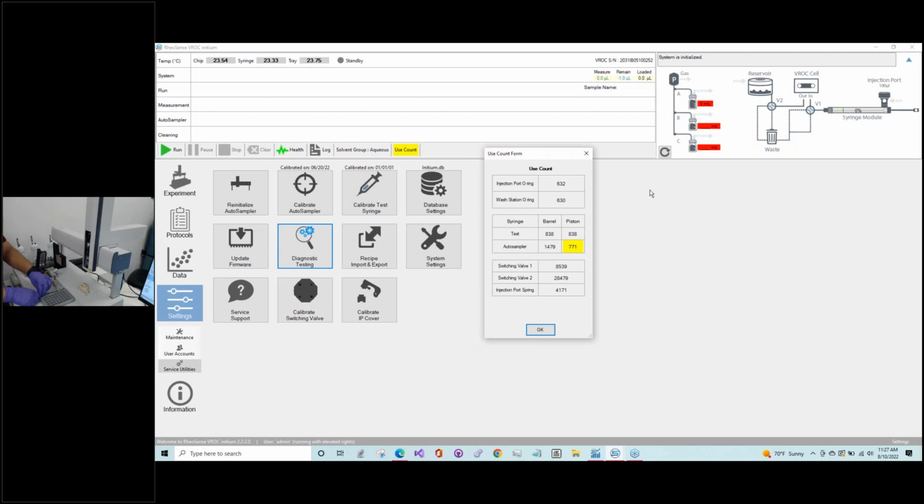And try not to, again, Marina had mentioned earlier that sometimes people tighten things very aggressively. This screw on the piston for the test syringe is one of the things that can easily be over-tightened, and it can be quite a challenge, once you do strip that screw, to actually get it undone.